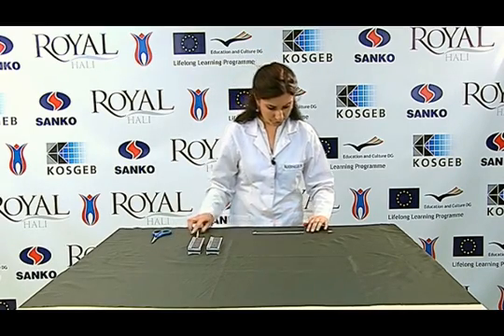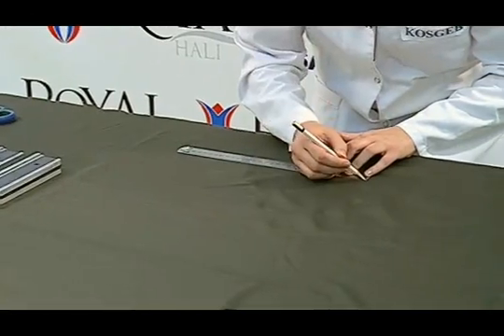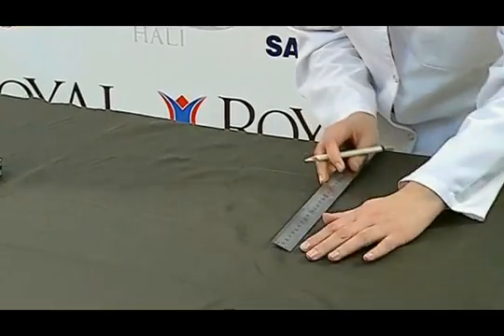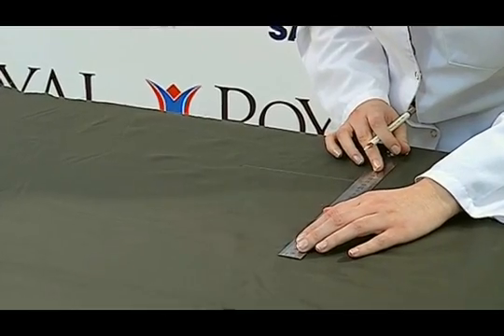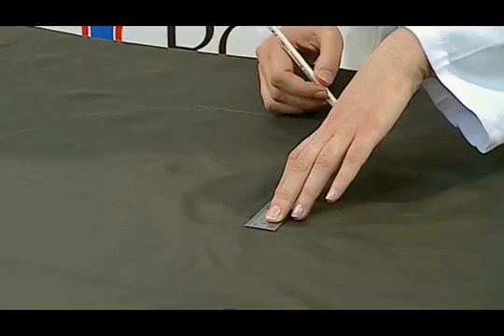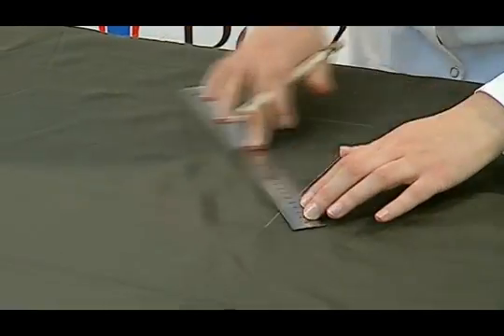The sample size is 220 mm by 150 mm. Samples of which the long selvage is parallel to the warp are tested according to the weft length, and those whose long selvage is parallel to the weft are tested according to the warp length.